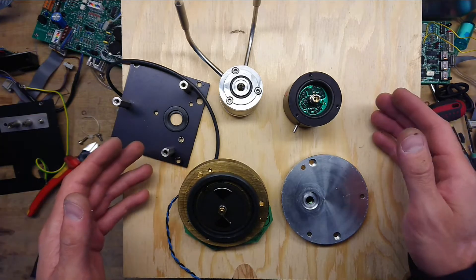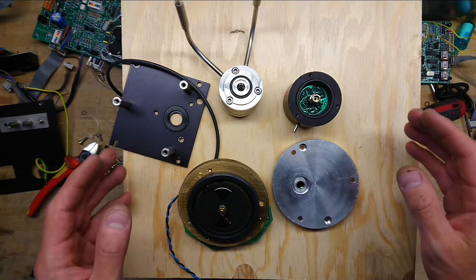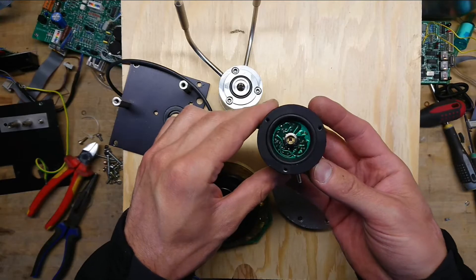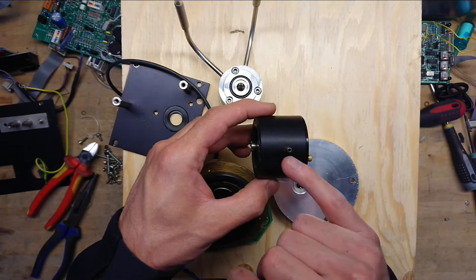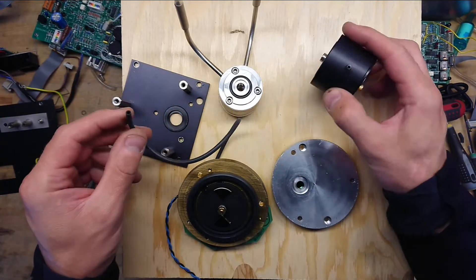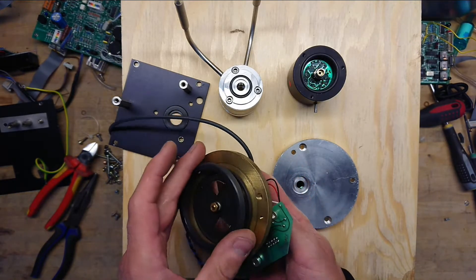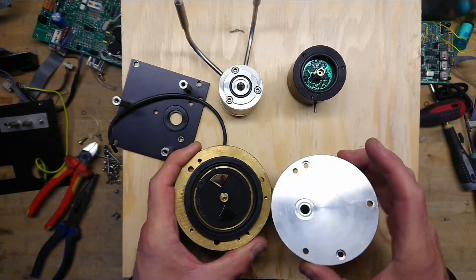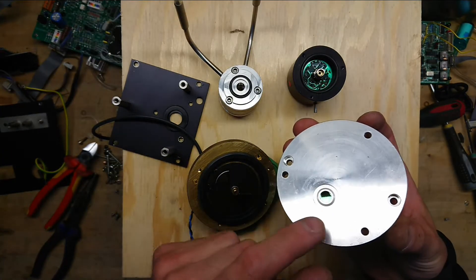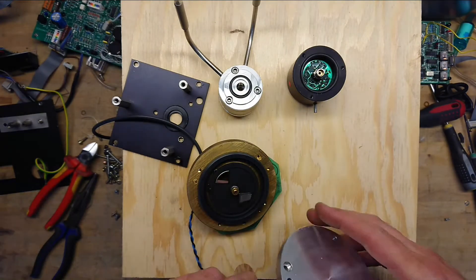The same goes for the sensor type. Incredible small details have been put into this to have it be a completely sealed unit. The sensor itself seems to be a pretty simple type — probably some analog IR infrared sensor. It has a little gas port along with a three-pin connector. The gas port connects via this black hose up to the back of the reference unit. This was a separately sealed compartment. It has a little window with some kind of reflective material that I cannot even see the sun through, so that's probably very blocking — perhaps it's some kind of laser wavelength and not just infrared.